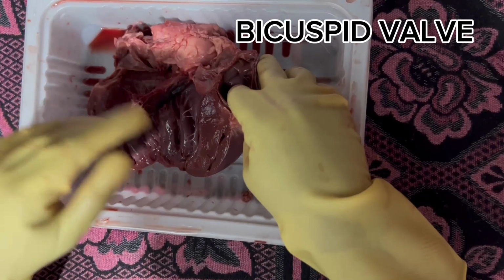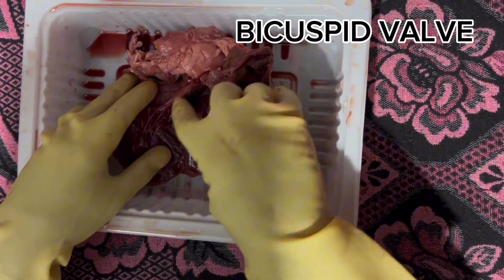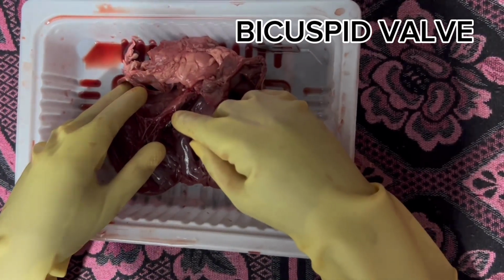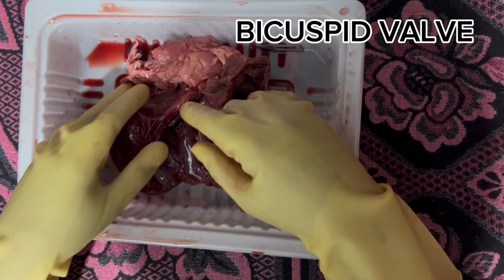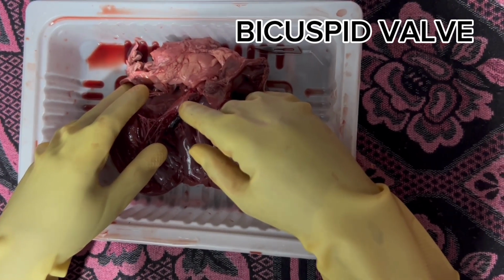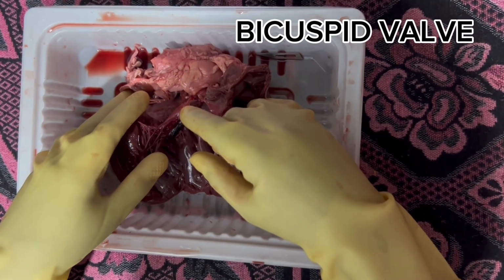Last one is the bicuspid valve. This is the bicuspid valve, also known as the mitral valve, which allows flow from the left atrium to the left ventricle. And the tricuspid valve sends the blood from the right atrium to the right ventricle.